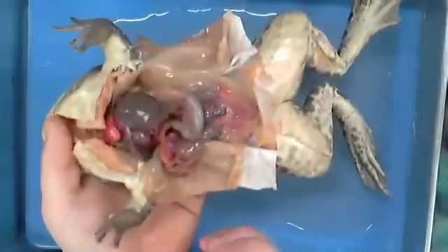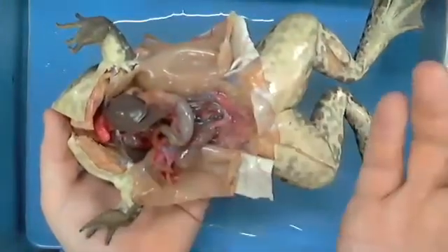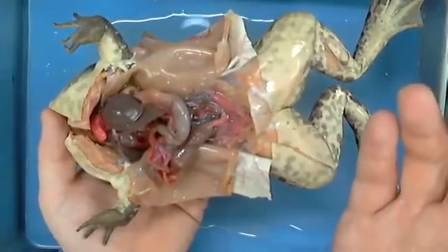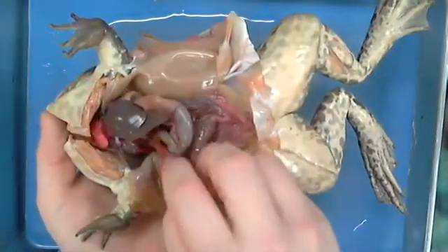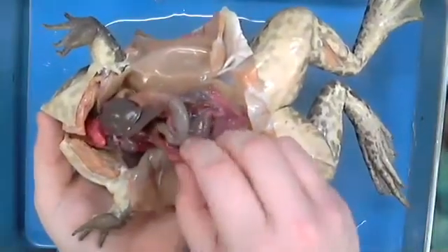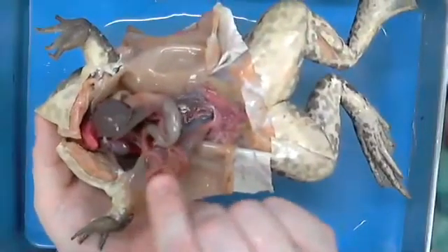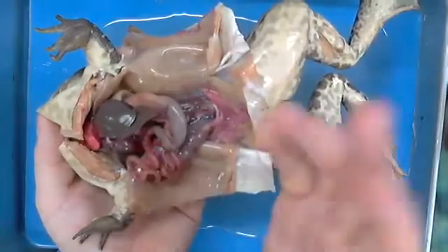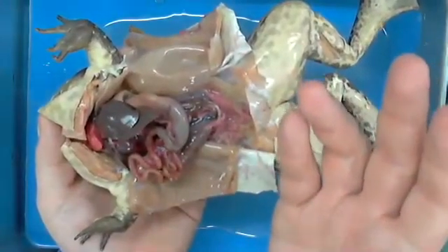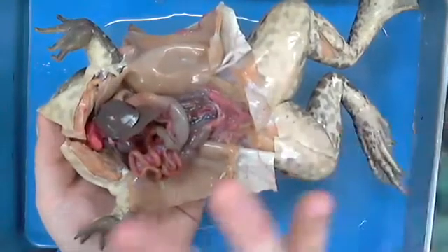Okay? So notice, if you will, those three things. Look, you have the ability to ask me if I were to point at this and Shauna says, is that attached to the small intestine? I have no problem being like, this is attached to it. That way she goes, oh, that's the small intestine, and yes, it's attached. That's how Shauna would ask that if she thought I may perhaps have been pointing at something else. Okay? So I don't want her to be confused.